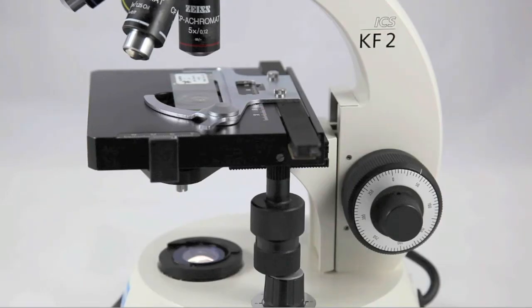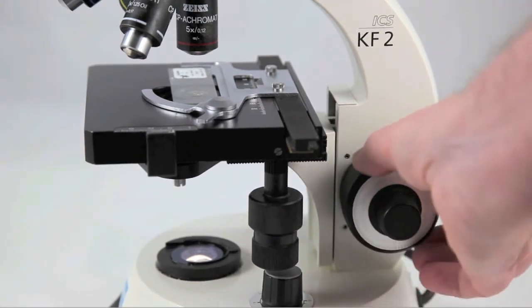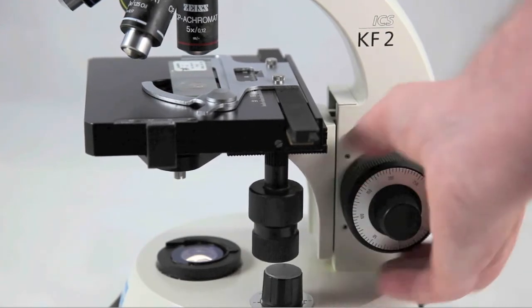Establish your initial focus using the scanning objective and the coarse focusing knob. If this is the first time you've used the microscope, you may have to raise the stage a considerable amount.